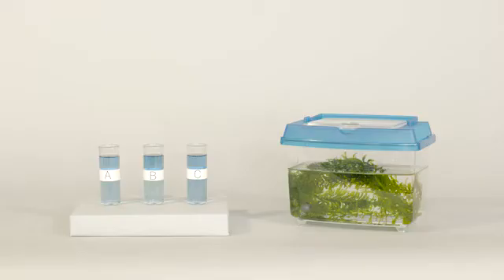Right now the vials have no carbon dioxide because we want to test which organisms give off carbon dioxide.